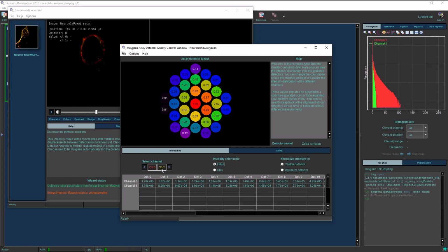If I click on channel 1, it will be disabled and I will still see a proper alignment. If I now click on this arrow to the right, I will disable channel 0 and enable channel 1 at the same time. And note that the intensities of the yellow fluorophores are not distributed over the entire array. The outer detectors did not capture as much light for the yellow channel as they did for the red channel. I will now enable both channels again.